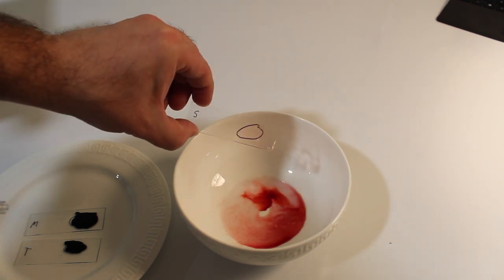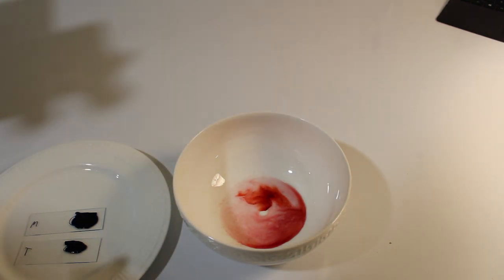Once sufficiently rinsed, this can be placed on paper to dry, or if you're in a rush, pressed gently between sheets of absorbent paper like paper towel.